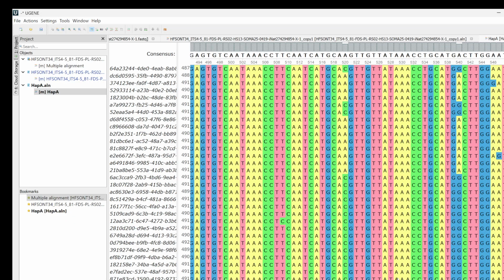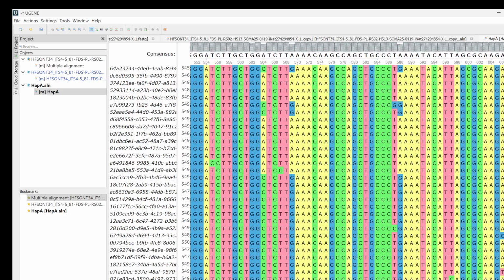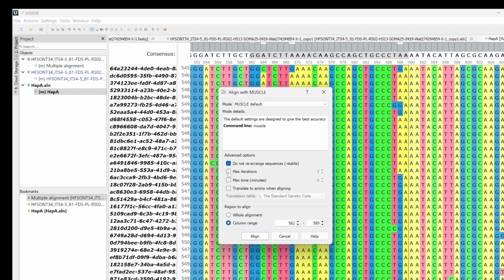So just for demonstrative purposes, maybe I'll see if we can do that. So again, I'm selecting the consensus up here, and then I'm going to go ahead and sort it out by all these columns here using muscle. And again, do not rearrange the sequences. You want to uncheck that. You want to rearrange them.